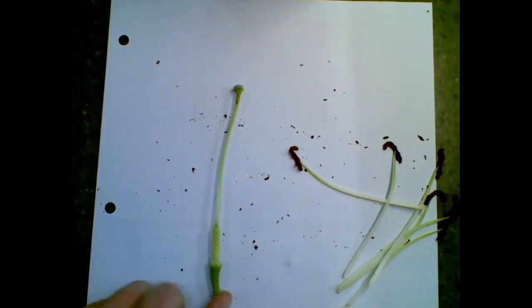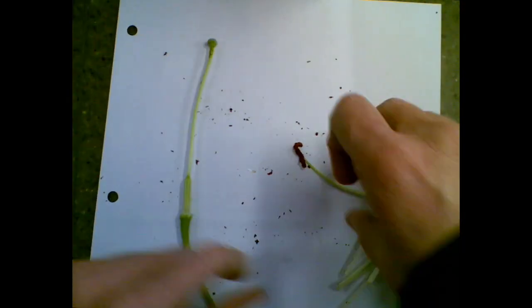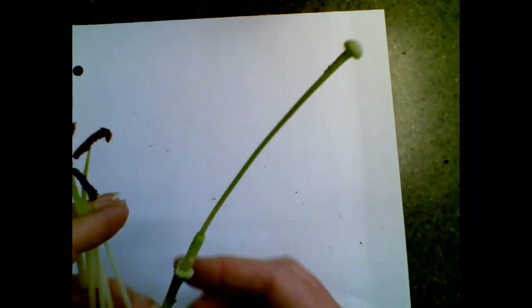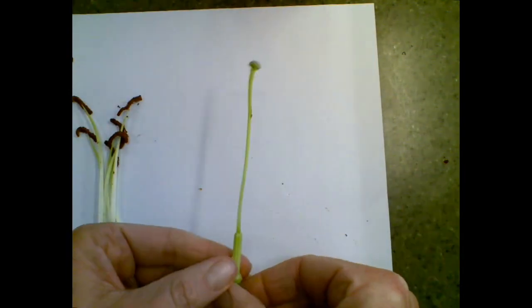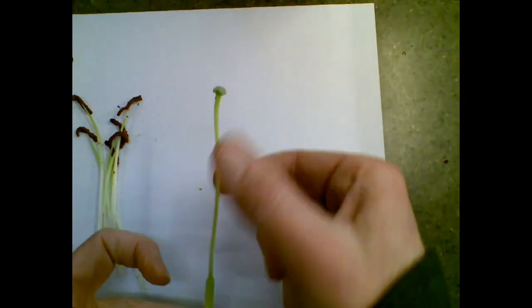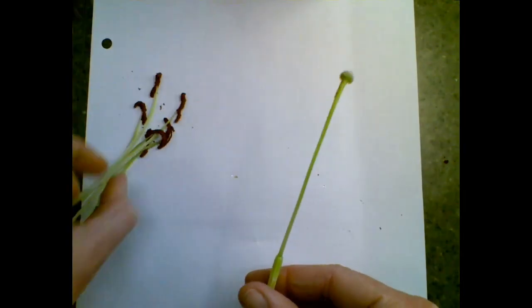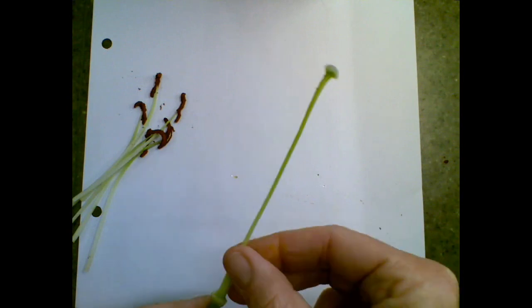This is the female part of the flower. And it's really quite big on this flower. Your flower might not be this big depending on what flower you get. Just had to get that all over the floor now. So the female part has 3, the whole thing's called a pistil. And I always think of like maybe a little kid who's a little girl who's a little sassy, a little spicy, and maybe she's like a little pistil.